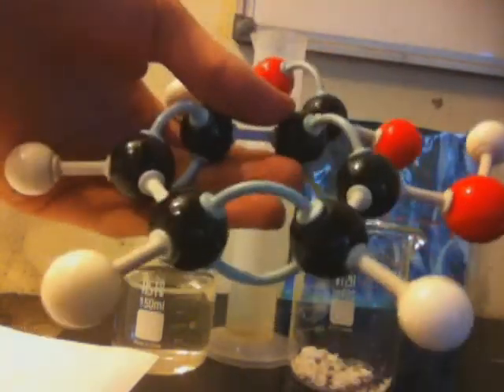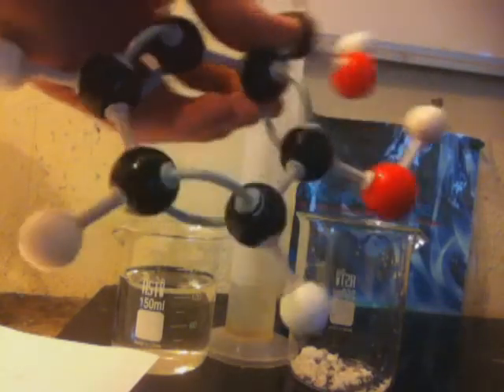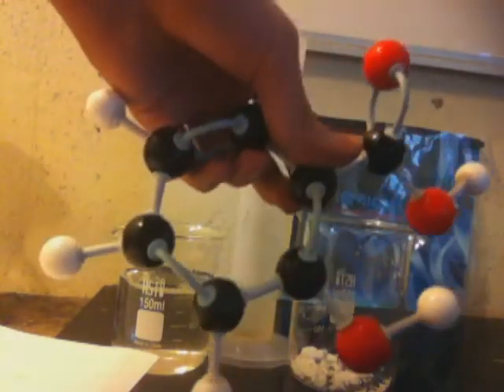There are people doing work outside the lab. And then we are going to be making this molecule — this is salicylic acid. I hope I did not do that wrong. No, I didn't. Okay, now this is salicylic acid. Salicylic acid is somewhat useful in the lab. I'm trying to work on a synthesis of benzene from it. So, let's get started on this.